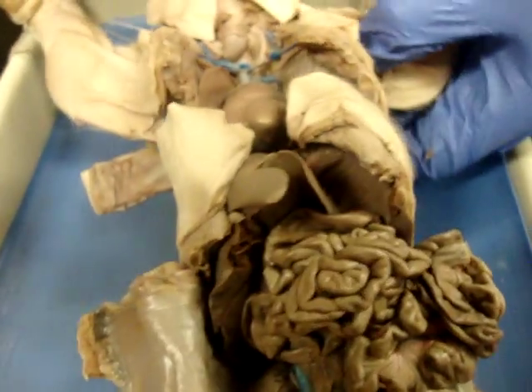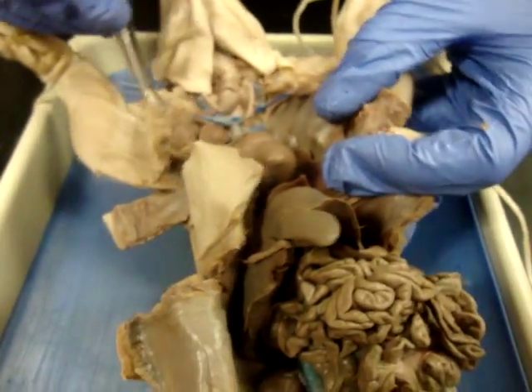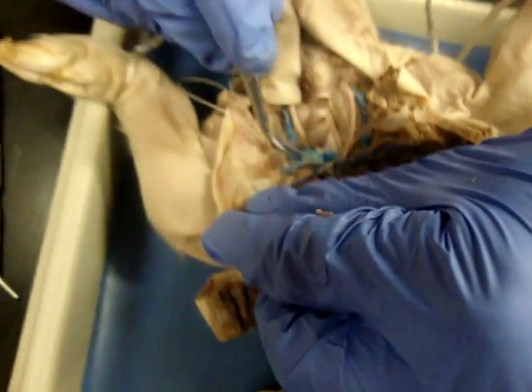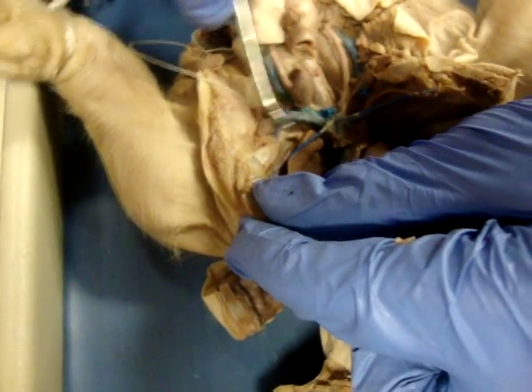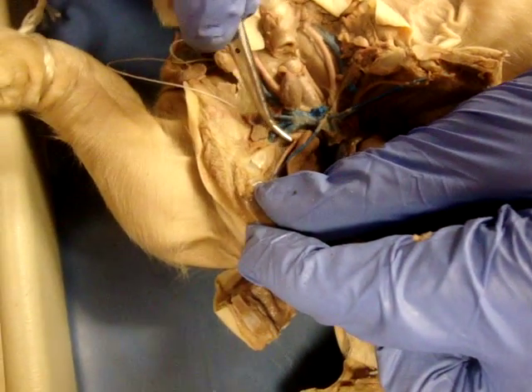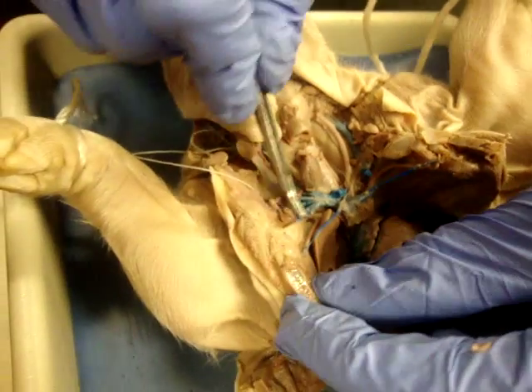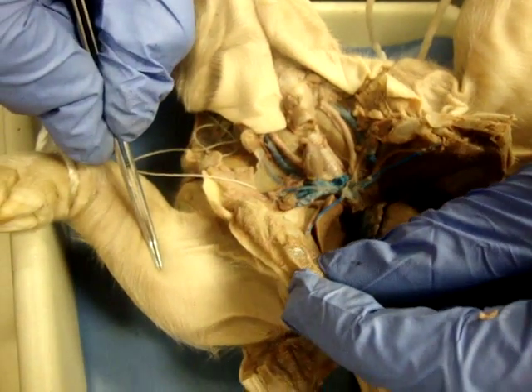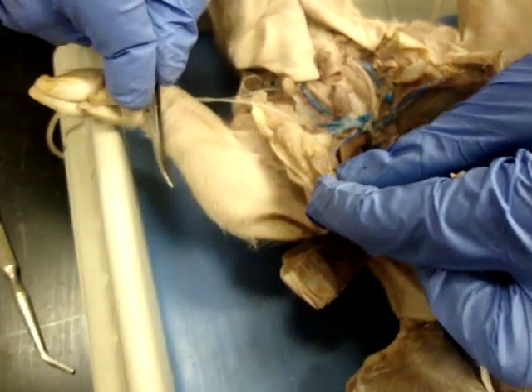Coming down from there, you want to be able to find your subclavian. Subclavian is going to tell you that it's heading into the arm region. In here, you've got your subclavian vein as well as your subclavian artery. The subclavian is the only thing you need to know for this course that's going to head into the arm region.